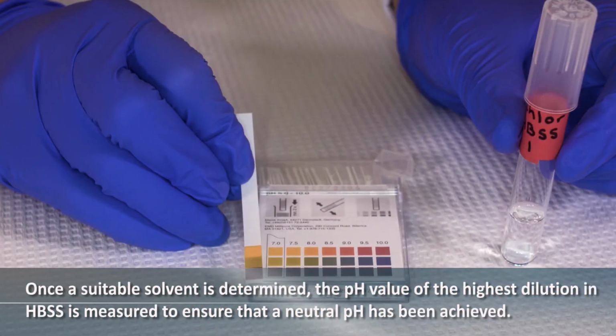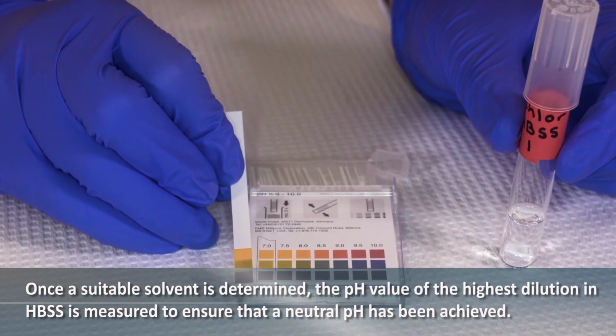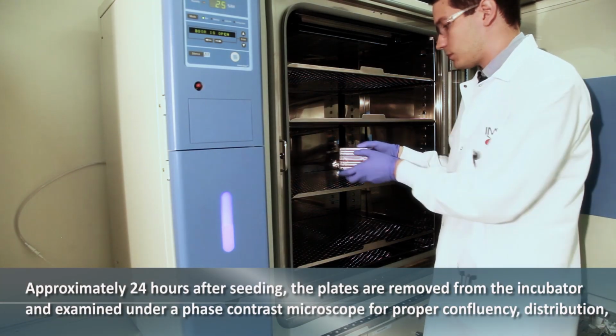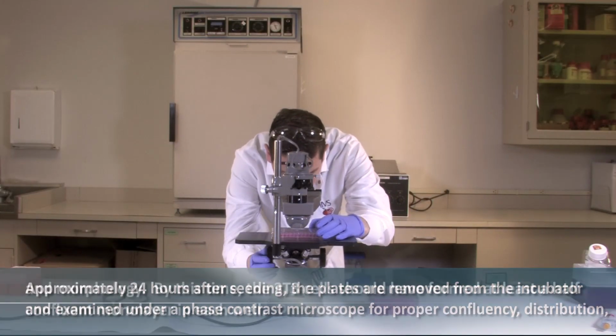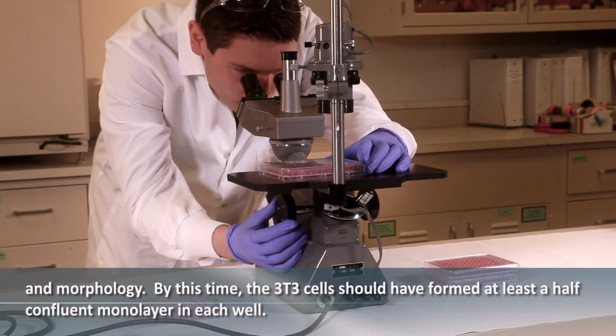Once a suitable solvent is determined, the pH value of the highest dilution in HBSS is measured to ensure that a neutral pH has been achieved. Approximately 24 hours after seeding, the plates are removed from the incubator and examined under a phase contrast microscope for proper confluency, distribution, and morphology. By this time, the 3T3 cells should have formed at least a half-confluent monolayer in each well.